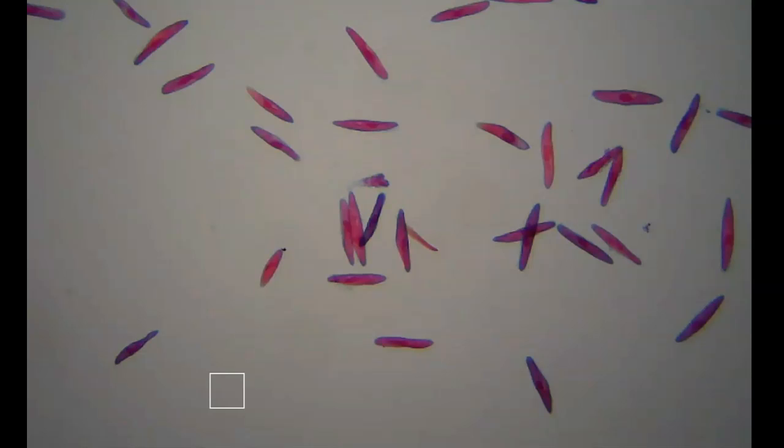Alright, so here we have a prepared slide of the Paramecium caudatum. We're currently looking at this organism through the 4 times objective. And you can see that they're in abundance in the slide here. So I like using this one just because it's pretty easy to find what we're looking at in the form of these prepared slides. You can also find your own by getting some pond water and kind of parsing through that to find some of these cells, these organisms.